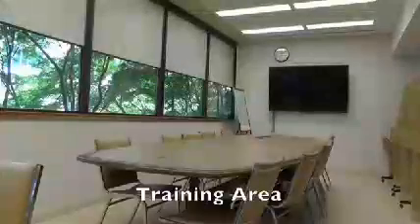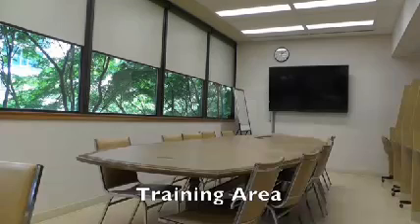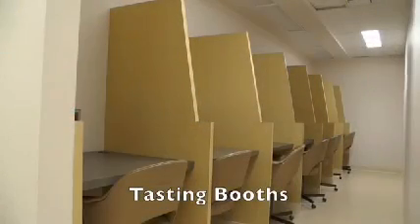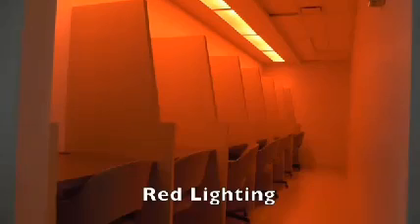This is the training area where panelists are calibrated in a way like machines would be, and they are taught how to precisely and accurately recognize certain characteristics when performing sensory analysis. These are the individual booths where panelists evaluate the foods. The booths come with normal lighting as well as red lighting to mask the differences in color between samples.